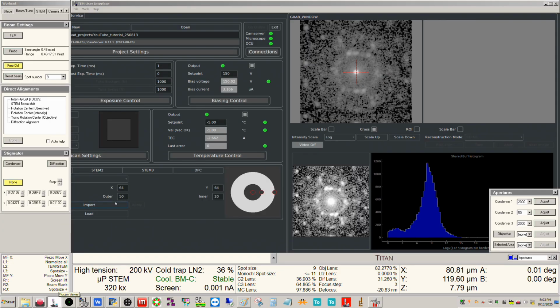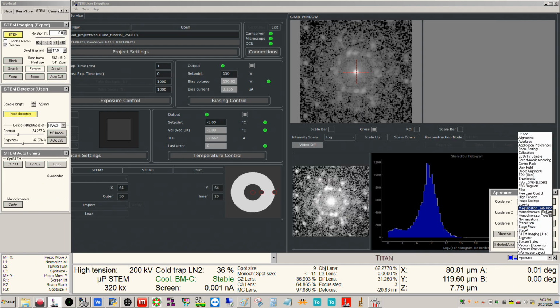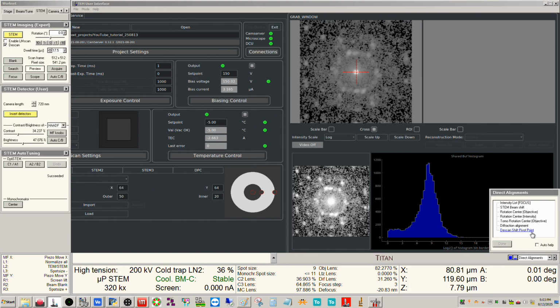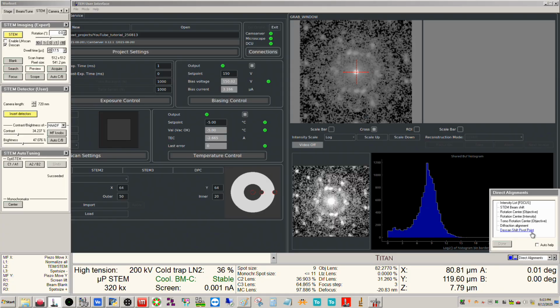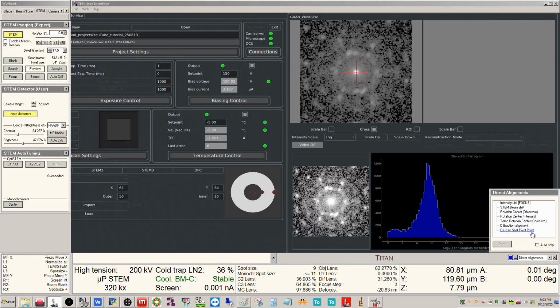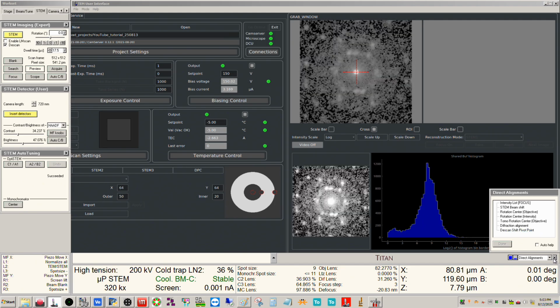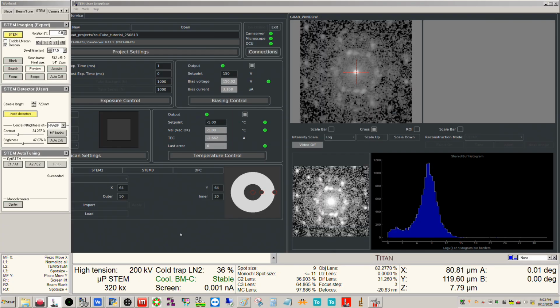And so, again, just briefly back to the D-scan artifact. If you check this D-scan here, there are direct alignments you can use to align this in theory or in principle. The problem is we've had a lot of issues with this not working properly, or being able to actually correct this well. This is something that we've had a lot of headaches with on this system. I don't know if on some other systems it's not quite as much of a problem, but I'm not going to go over that because I have trouble getting it to work anyway. But there are direct alignments you can do to in principle correct the D-scan artifact. Again at atomic resolution in nanoprobe mode, it's going to be completely irrelevant anyway.